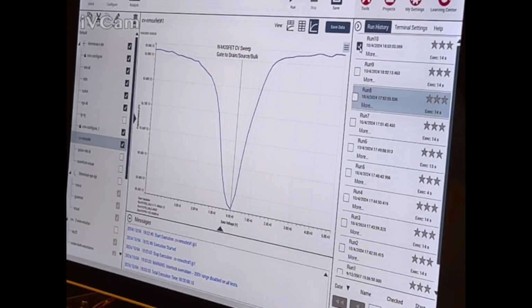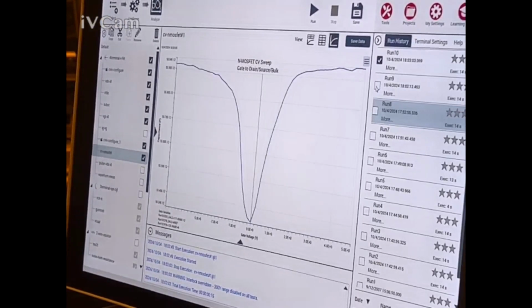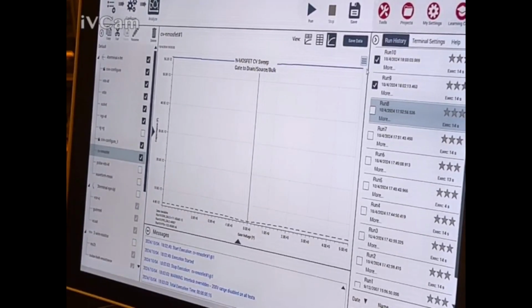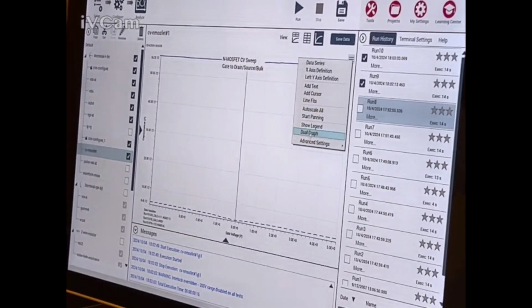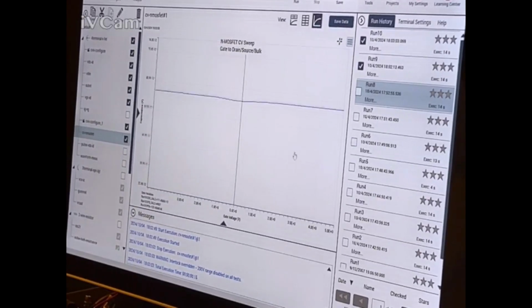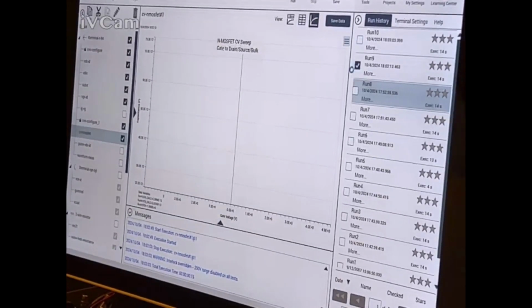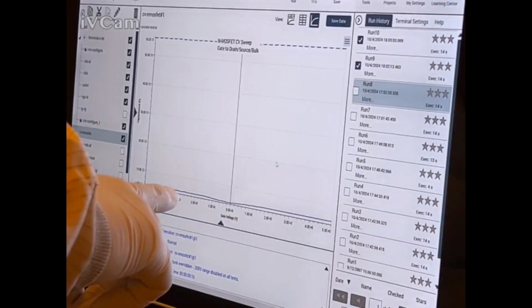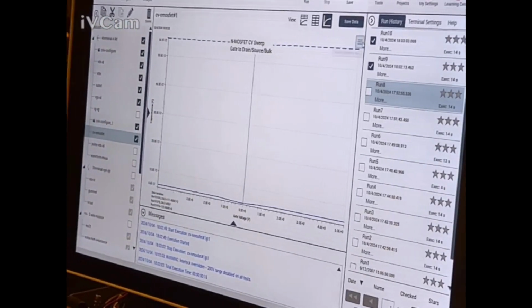You just have to rescale the y-axis. The auto scale should work with that. That's what I don't understand, because right now it's 55. The other one is like 14. That's a bug. I think that's not right. That should auto scale. It's showing it as a flat line. It's not a flat line. It's just that the scale has to be... Oh, the scale's way wrong. Yeah. What the heck is that all about?